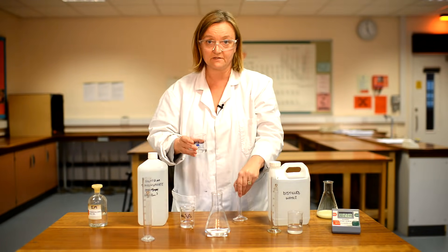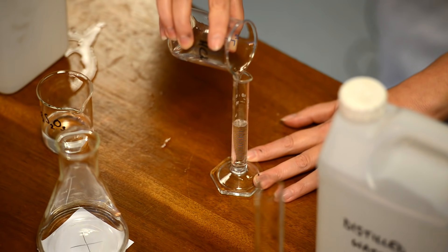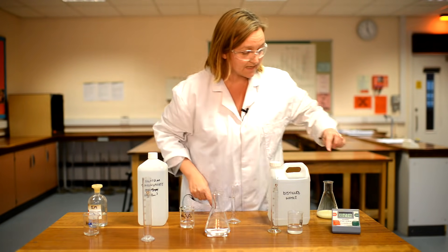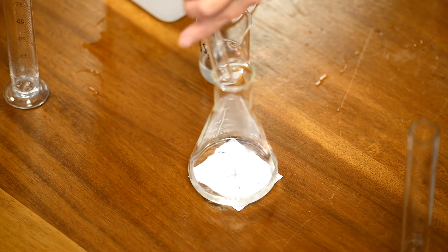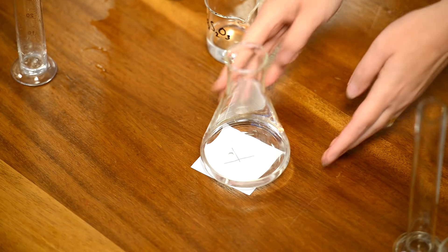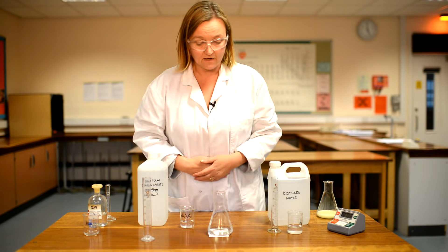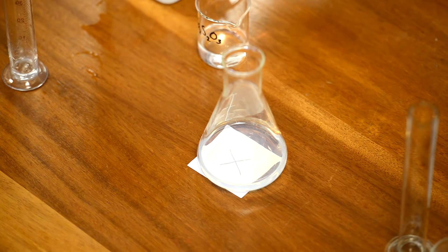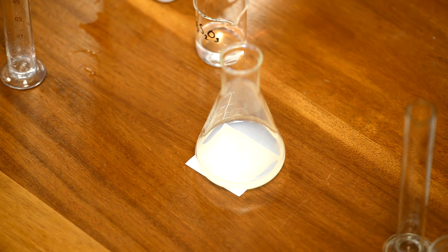I'm going to add my 10 centimetres cubed of hydrochloric acid, being careful to get the measurement accurate, reset my clock, and start again. I pour the acid in, start the clock, give it a little swirl, and keep everything else constant — the same volume of solution, the same cross, and the same person observing it. I'm watching directly from above until I can no longer see the cross. Take care not to breathe in the sulphur dioxide fumes that come off, as it can make you cough.